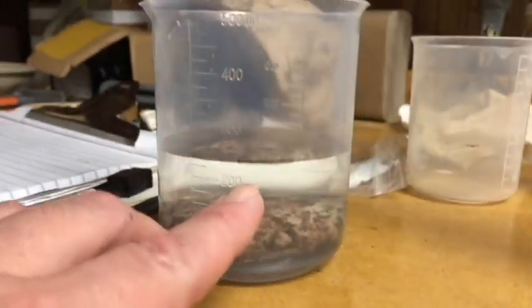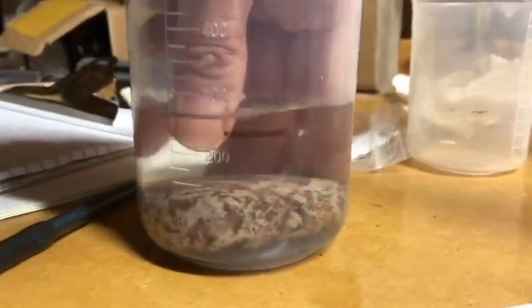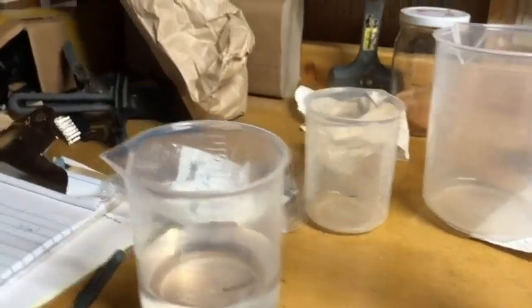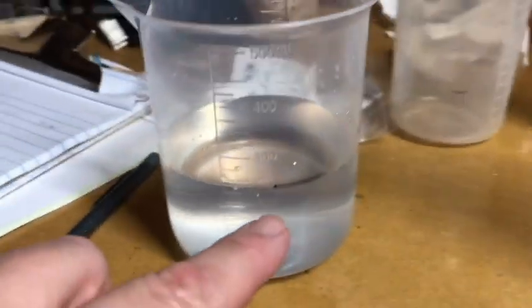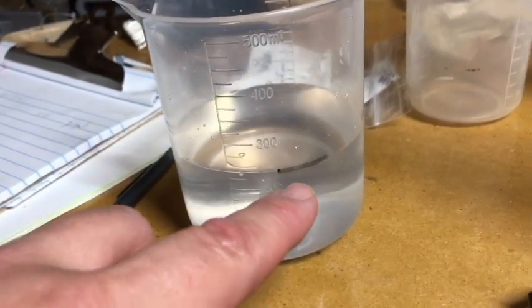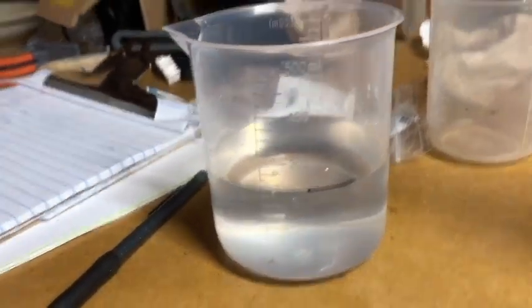I drew a line here with an erasable marker. I'm going to take this out because I'm done with my rock, and it doesn't matter if I get my hand covered with water or not. Put it over here to dry out. Now I'm going to fill this as accurately and precisely as I can to that line. When you do this, you want to be consistent with how you fill it up. So if you drew your line when the rock was in there at the top of the meniscus instead of the bottom, you want to do that again just to be consistent.